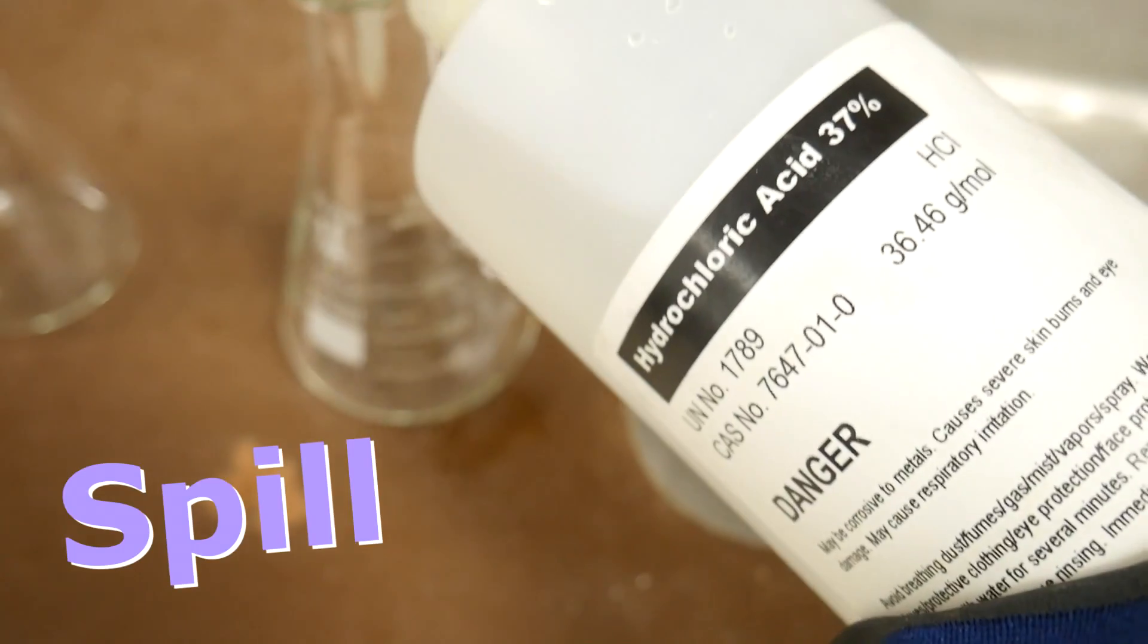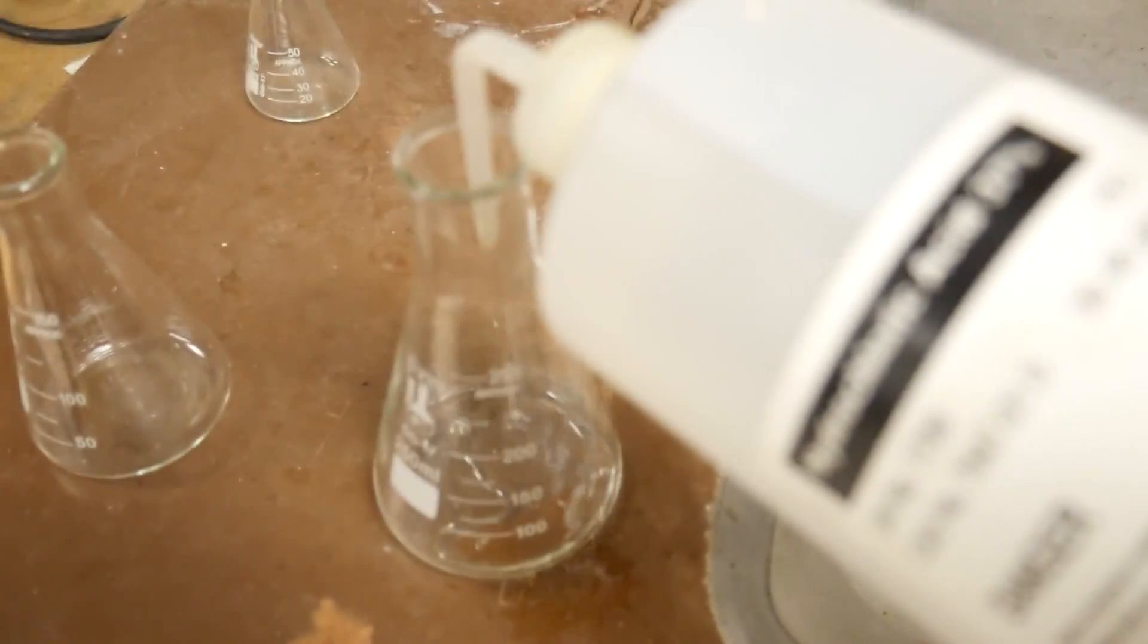Should you happen to spill hydrochloric acid, first neutralize it with baking soda then dilute it with lots of water before wiping it up.